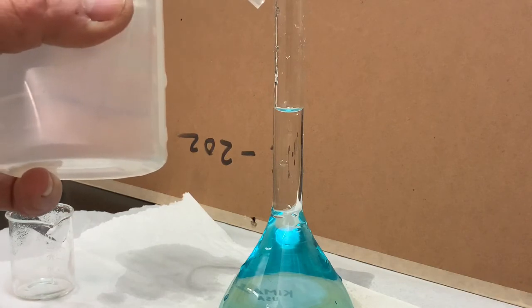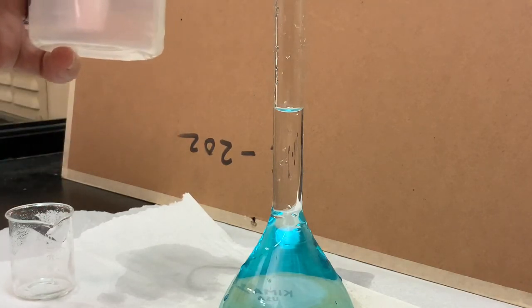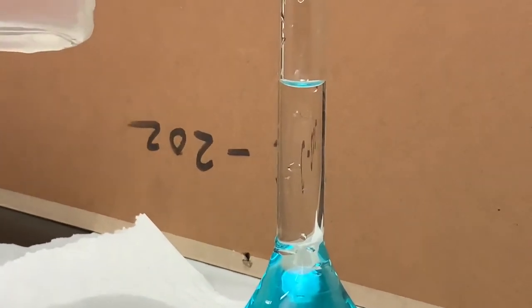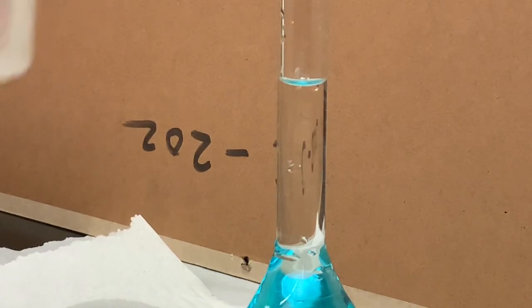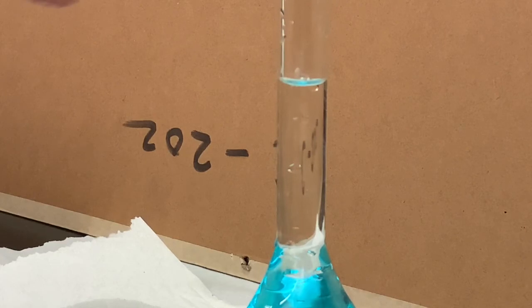Let's take a little bit closer look, and we may need an extra drop or two to complete the 250 milliliters, containing all of the copper ions that resulted from the reaction of the brass sample that was weighed.